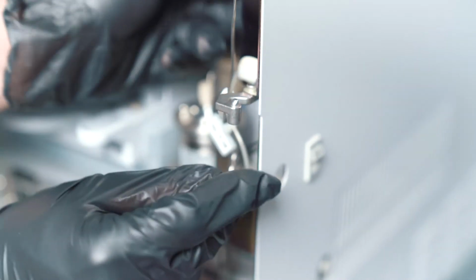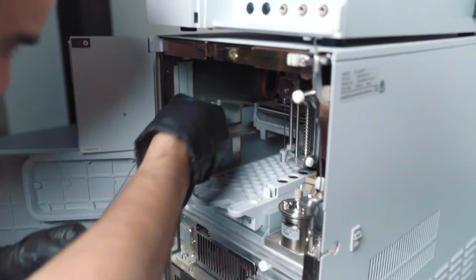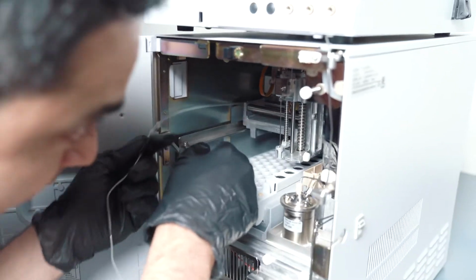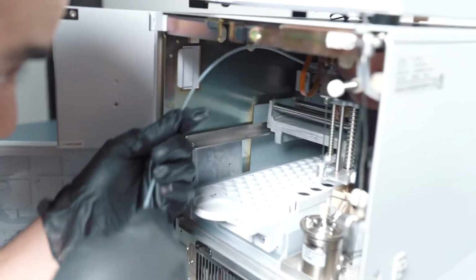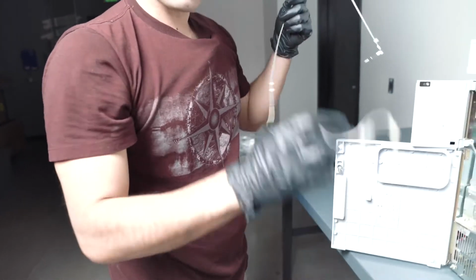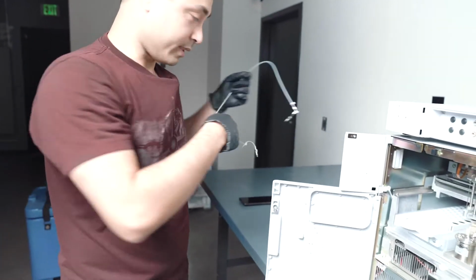So now that that's out, this is a 100 microliter loop, by the way. And there's other ones too. You can have a smaller loop. Sometimes I see 50s. It just depends on what your standard injection volume is. But 100 is pretty typical for this unit. Okay, so now the injection loop is out. And voila, there's your loop. So now let's get a new loop and replace it.